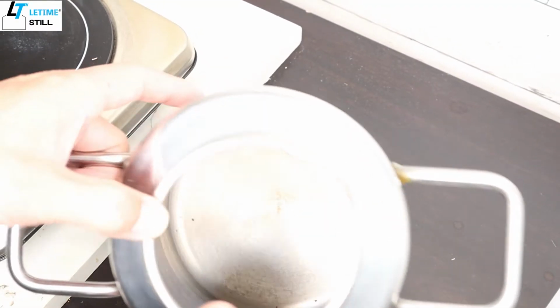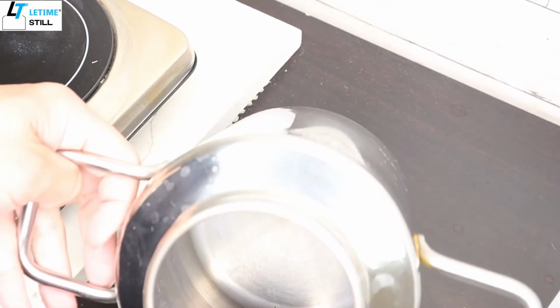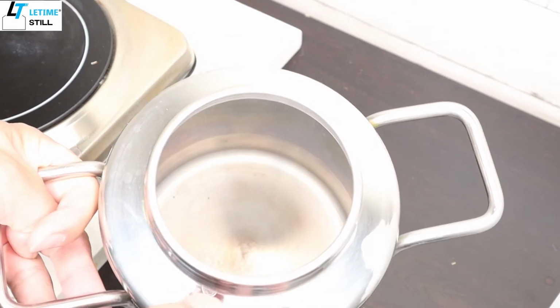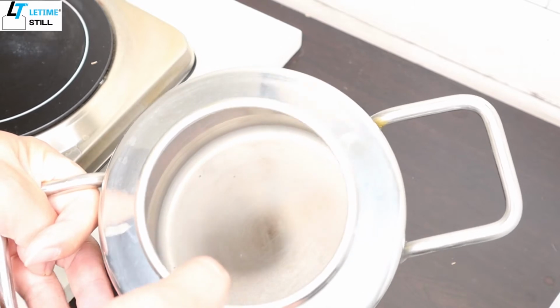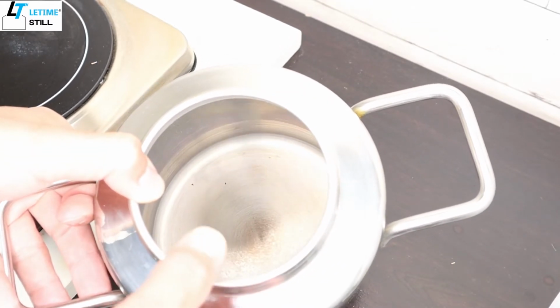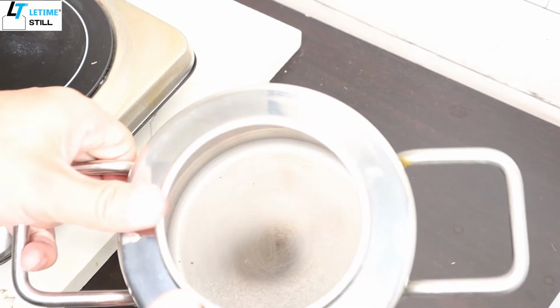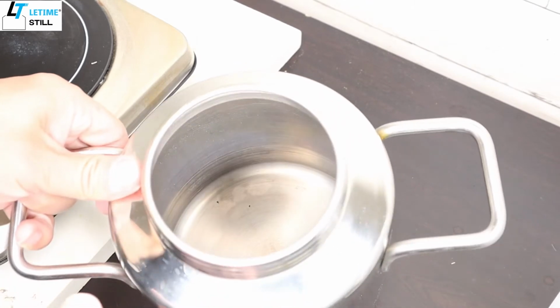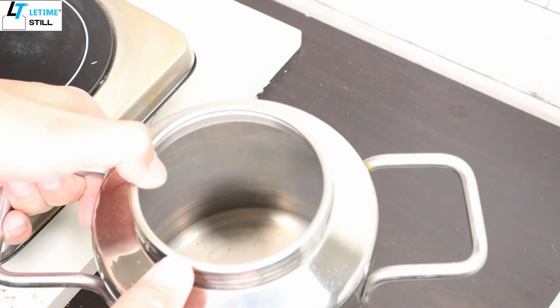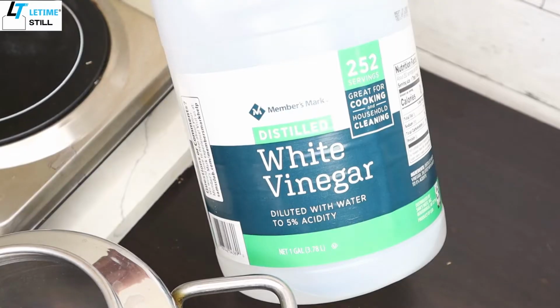The scale can be formed from the hardness in the water, and also you may drip some of the plant material into the pot during the distillation, and the pigment from the plant material can be deposited. Or sometimes you just overcook and leave a burn mark. For all of those, you can use white vinegar.